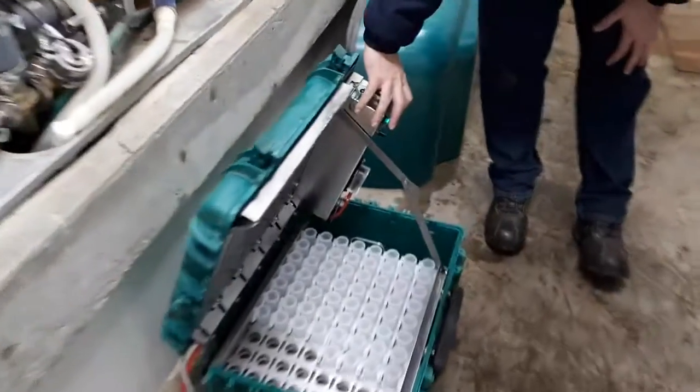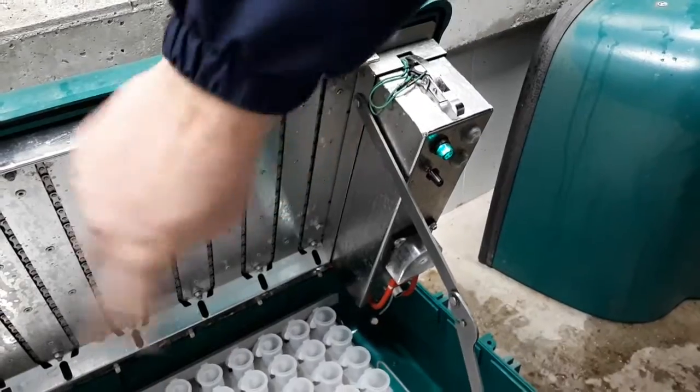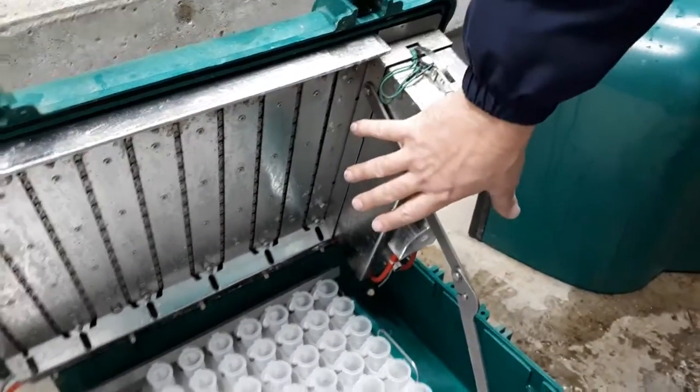We're going to go over to the sampler and hit the reset button. We just hit it — this one's already been reset. Sometimes this chain will run through its course; what it's doing is putting it back to the home position.